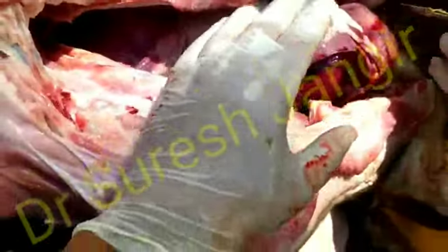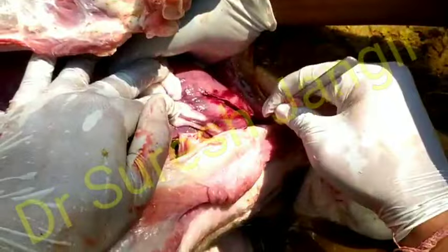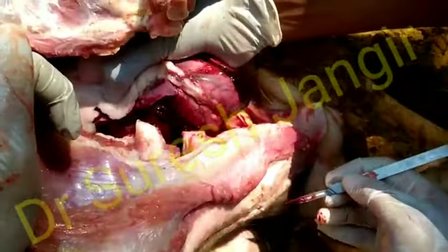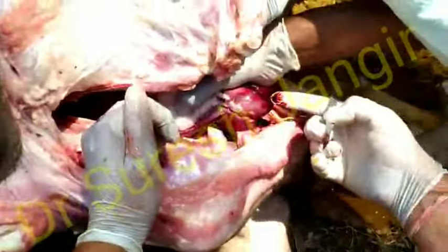Now we should open the ventricles of the heart. On opening of the ventricles, we found clotted blood here — clots of blood — and that is due to cardiac arrest.